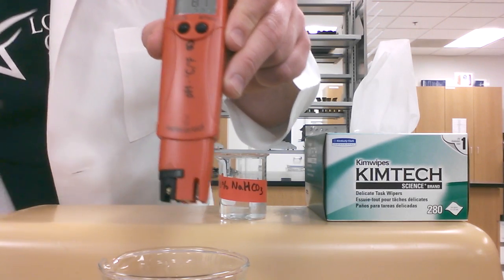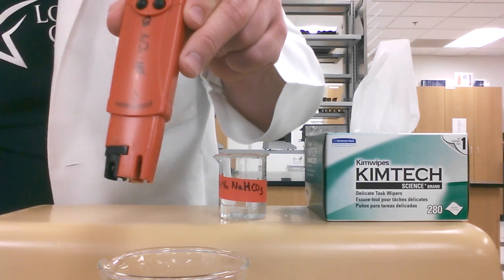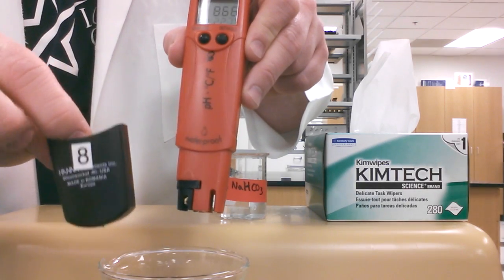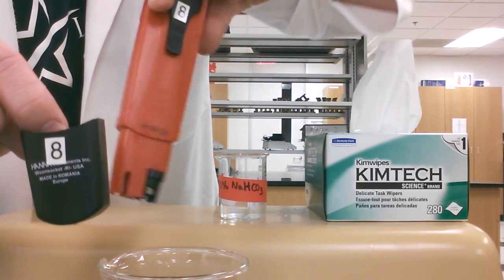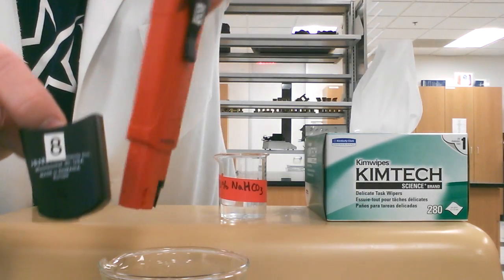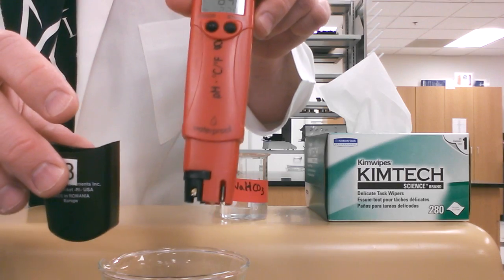After you've done that, you're ready to put your cap back on. Here I have the caps numbered, so if you see this cap is number eight, this pH meter is also number eight.